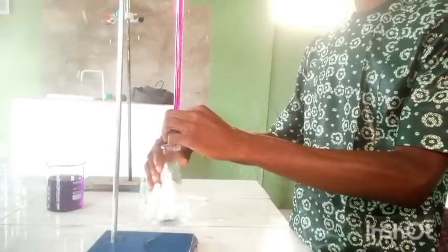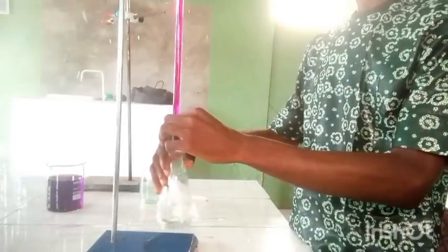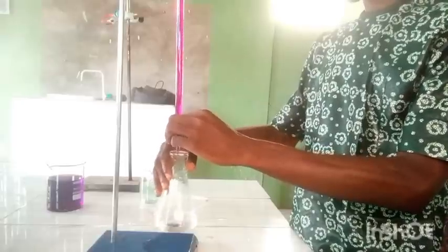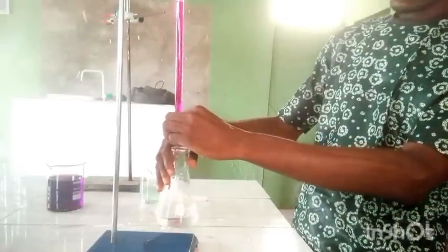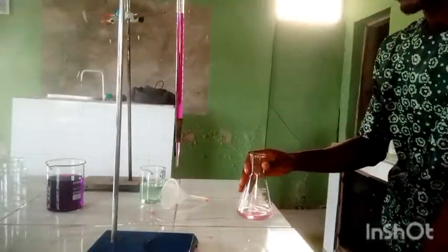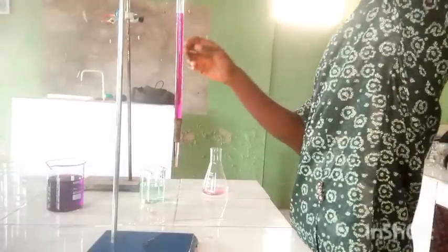We go again for the second titration. The colour has changed again, giving us the next reading of 39.60cm³. For the third titration, I refill the burette back to zero for convenience, then pipette my volume of B again.